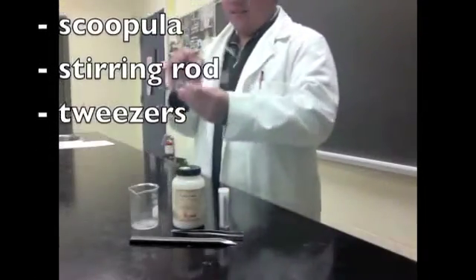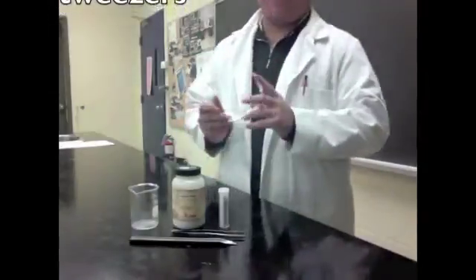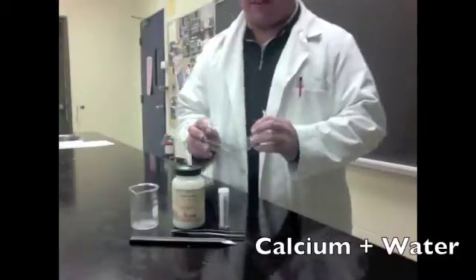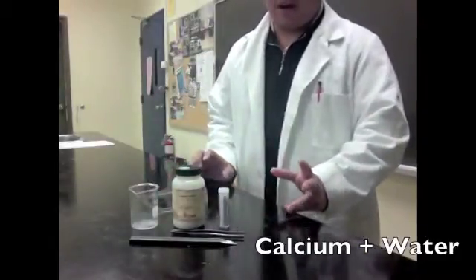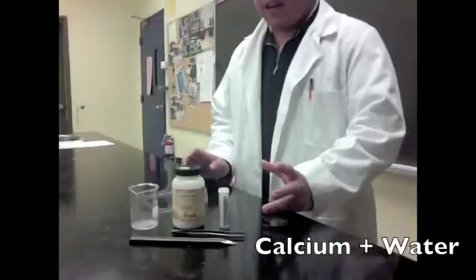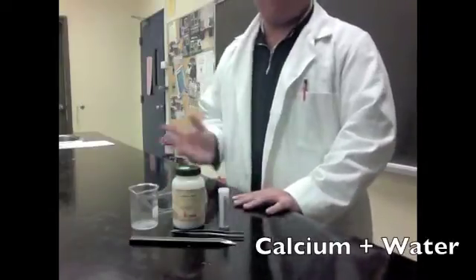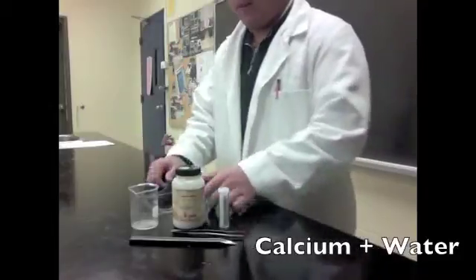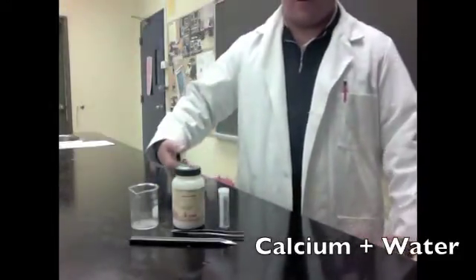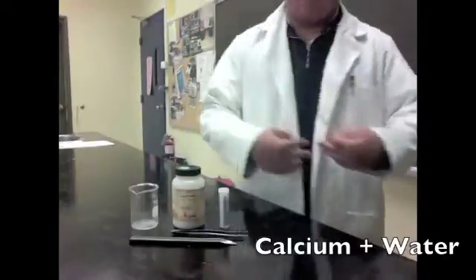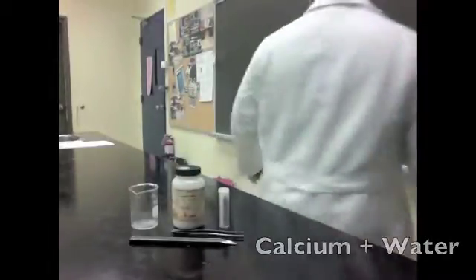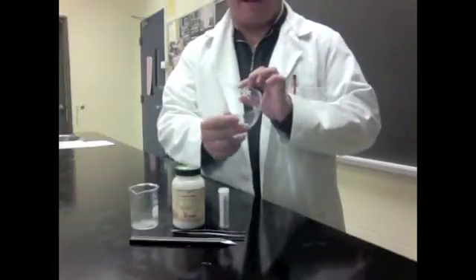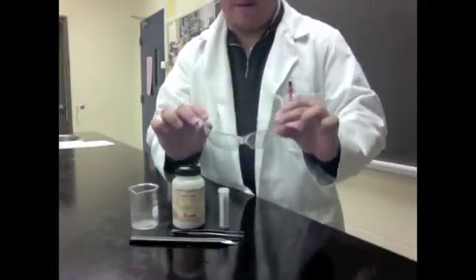Hi class, I didn't see you there. My name is Mark, and today we're just going to be doing a little experiment known as the calcium and water station in your lab today. And first we're going to start off by looking at our products, what we have for our station. But the most important role we should really look at is safety, which is number one within all chemical experiments. So firstly, as you know, I have a lab coat on. It's for protecting my body from all the other chemicals. And secondly, I have my goggles, which are really important for protecting our eyes, as you will need them in this experiment.